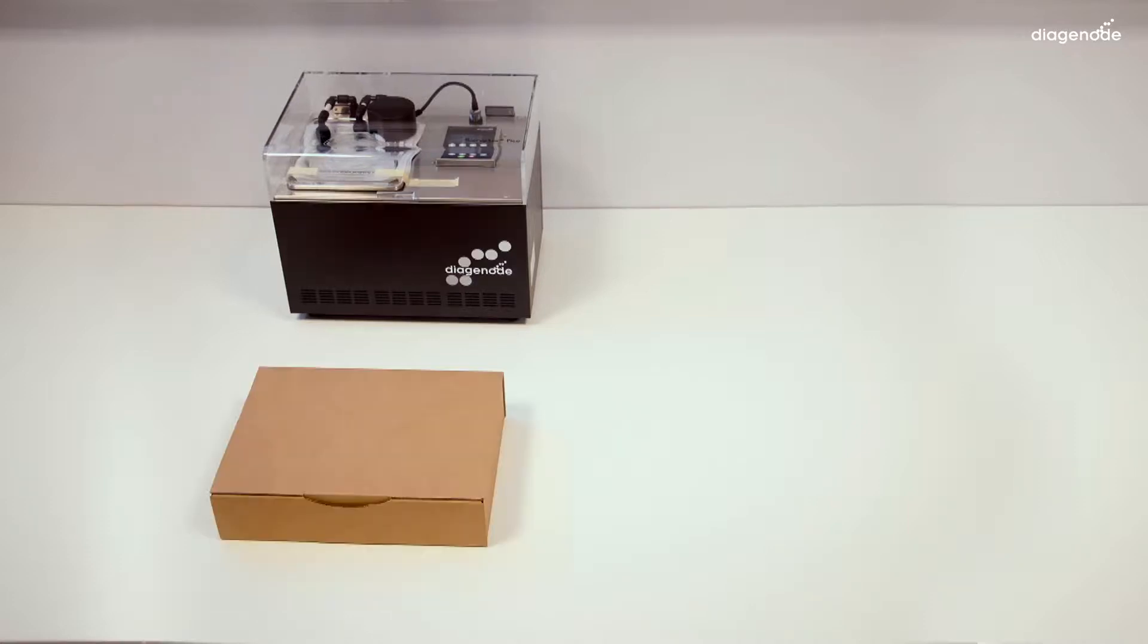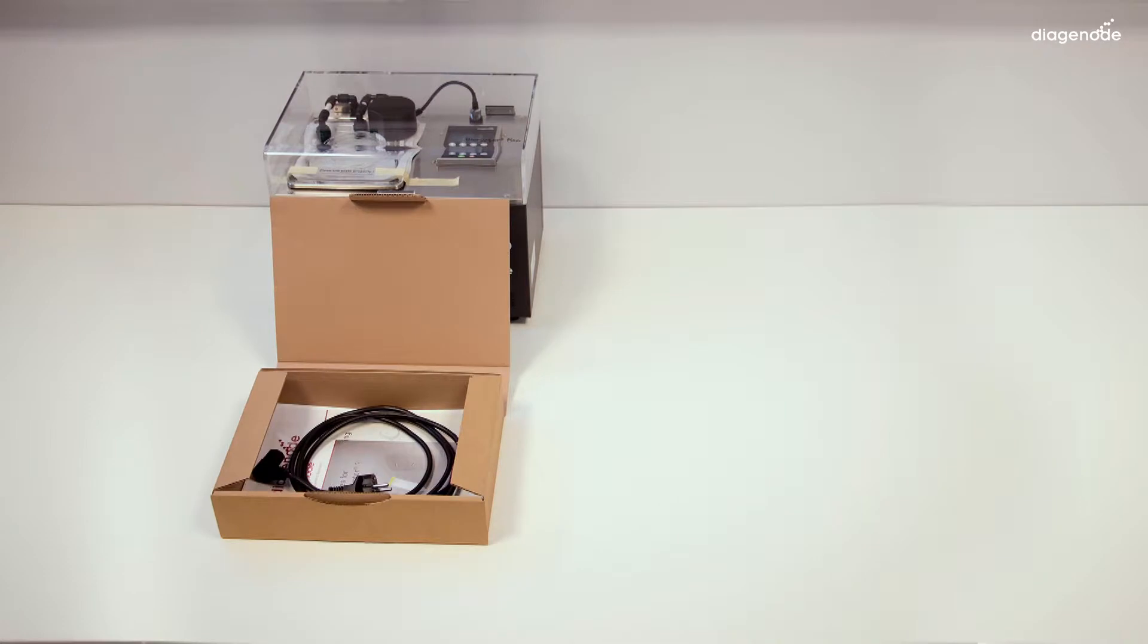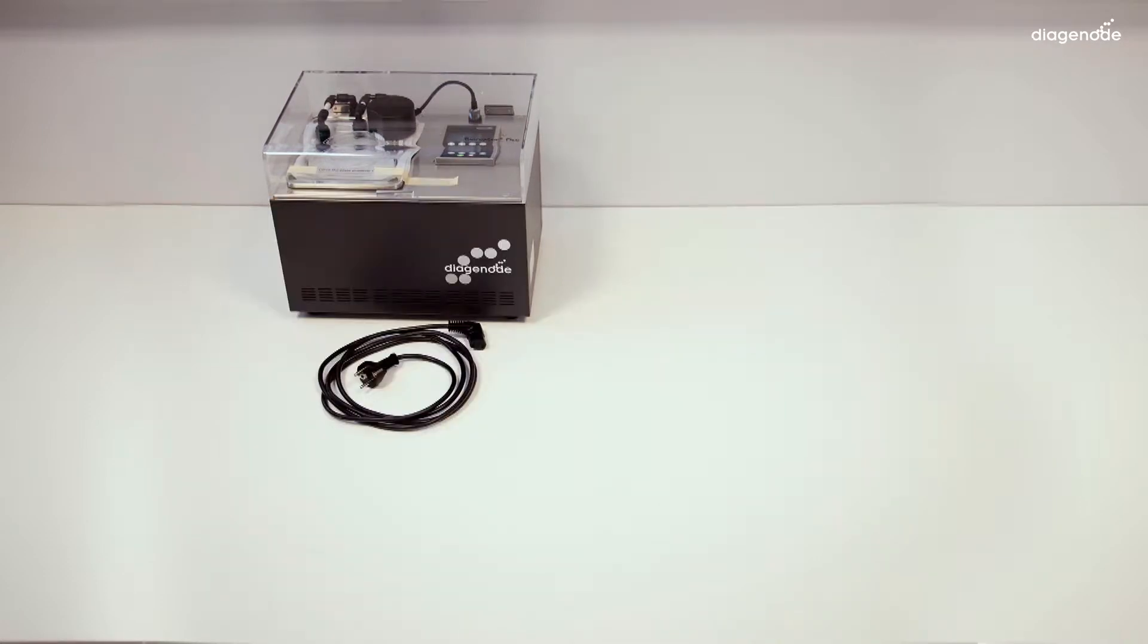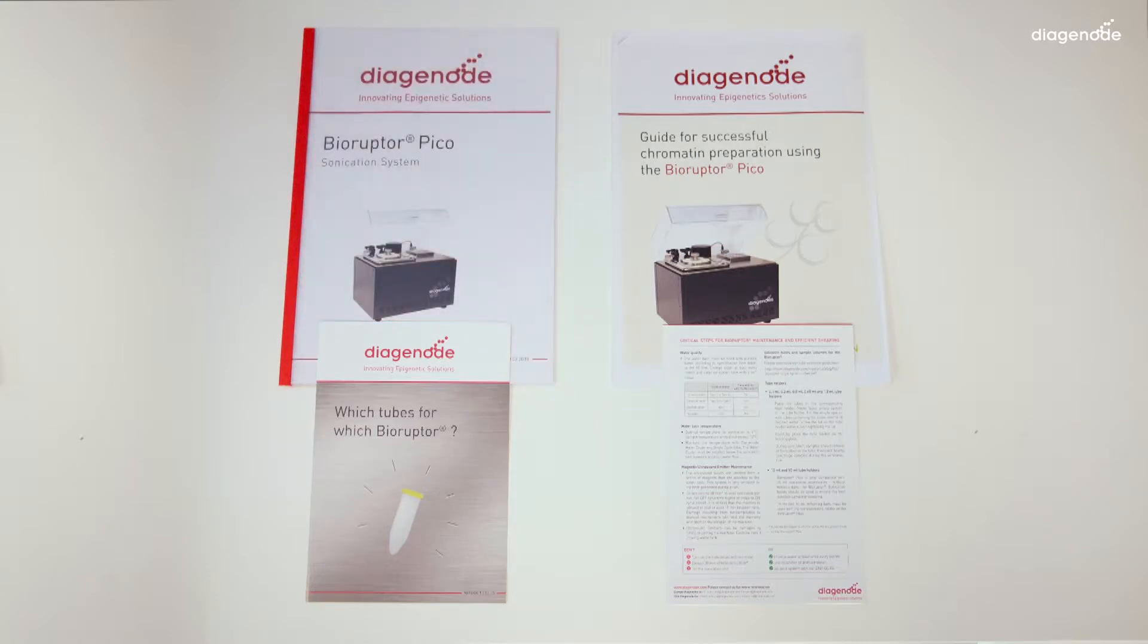You'll find a third box, and you can find inside the mains black plug, a user manual, a manual for good chromatin preparation, a guideline for tubes, and a guideline for critical steps.